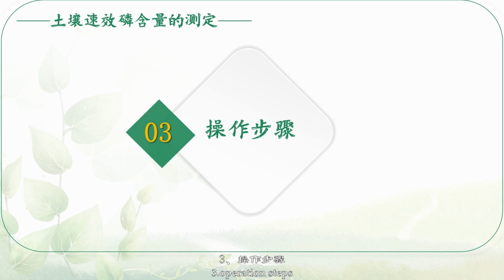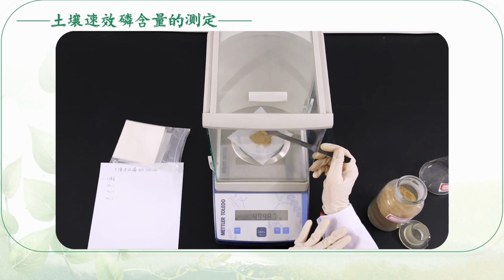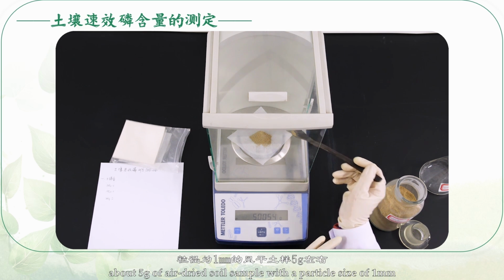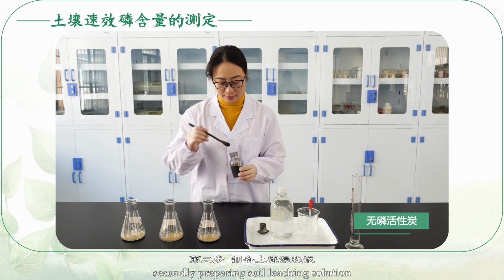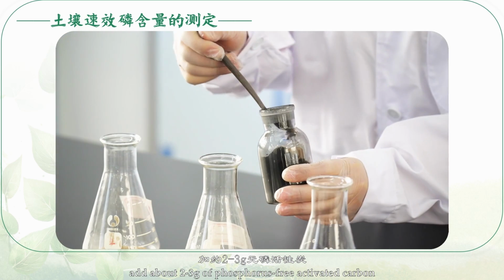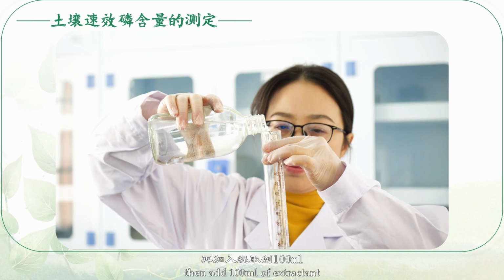3. Operation steps. The first step is to weigh the soil sample. Accurately weigh about 5 grams of air-dried soil sample with a particle size of 1 millimeter and place it in a 250 milliliter triangular bottle. Secondly, preparing soil leaching solution. Add about 2 to 3 grams of phosphorus-free activated carbon, then add 100 milliliters of extractant.